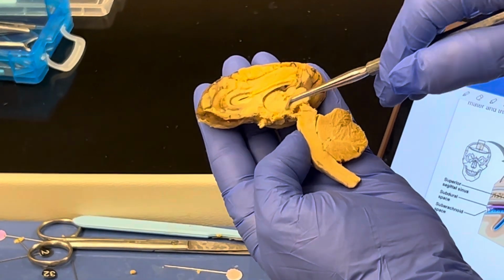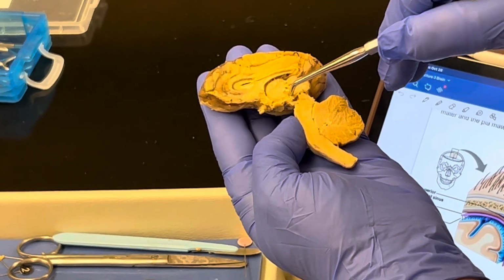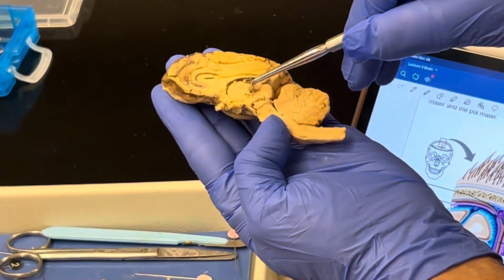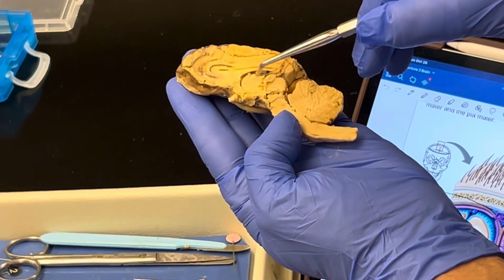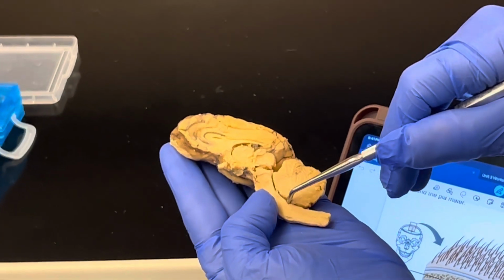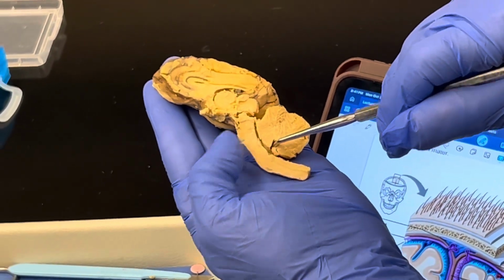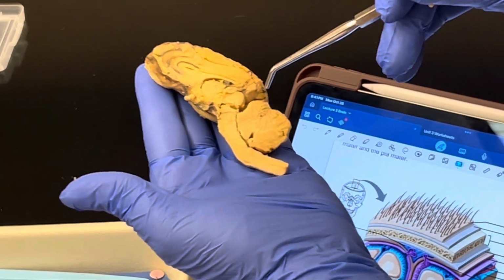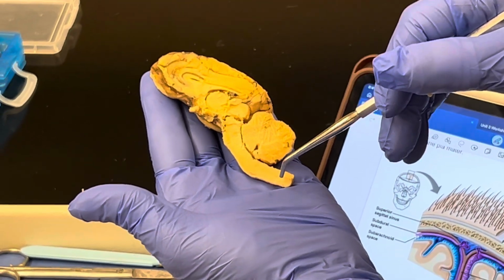From the third ventricle around the thalamus, we have this little channel here, and this is known as the cerebral aqueduct, which allows cerebrospinal fluid to travel not only from the third ventricle, but down through the cerebral aqueduct all the way into this region here in the cerebellum known as the fourth ventricle. This little dark line here is also a channel we will see later on when we do the spinal cord, known as the central canal, where cerebrospinal fluid will also flow down.